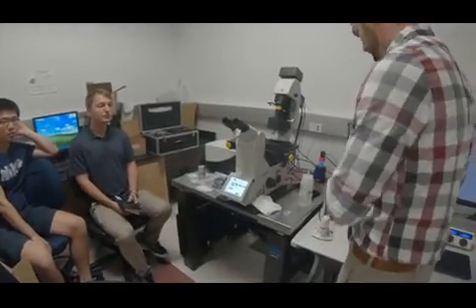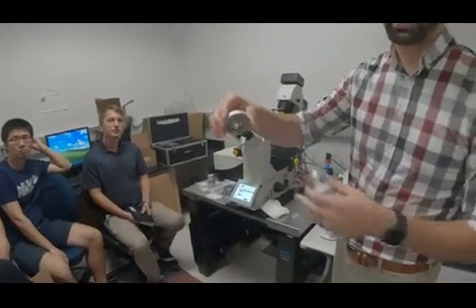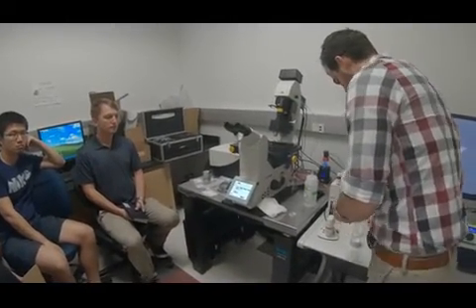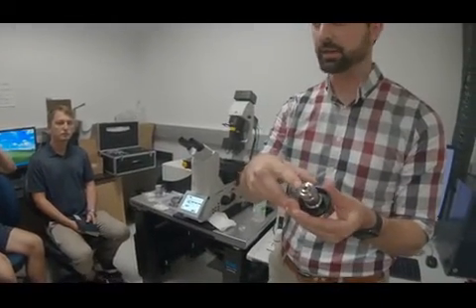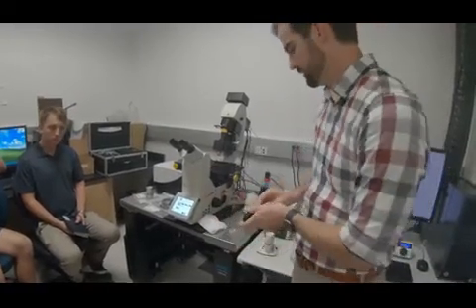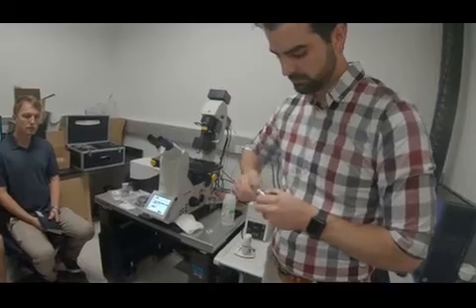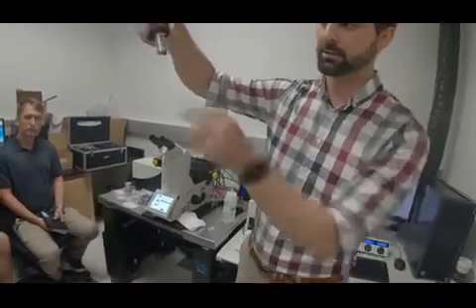The way we form that plane is with mirrors. We have three different mirror caps, and these thread onto one of the three detection objectives. This is the 5x objective, and the cap is threaded, which is not normal. Then this will thread onto it, like this.